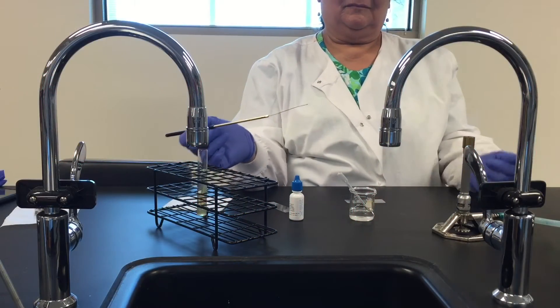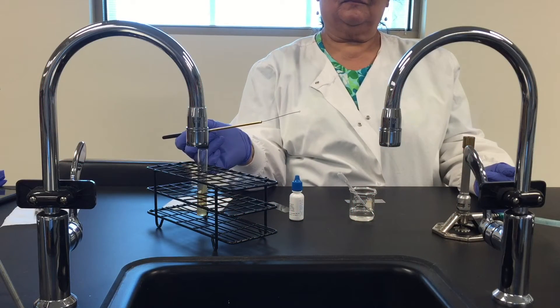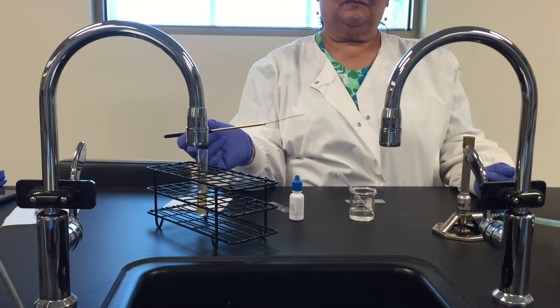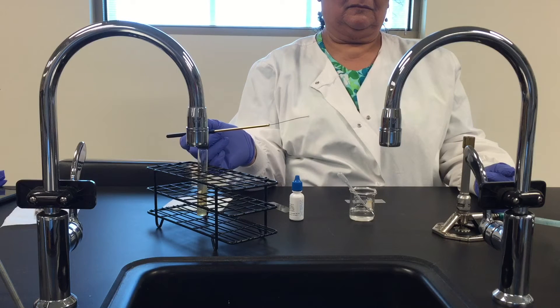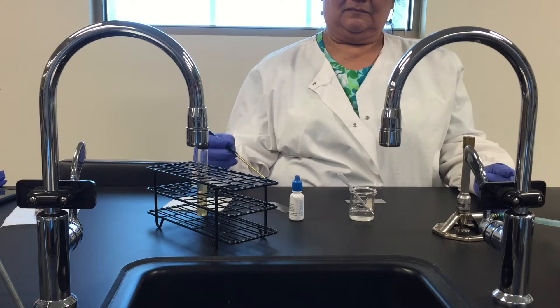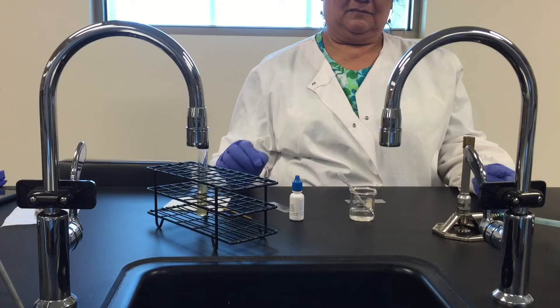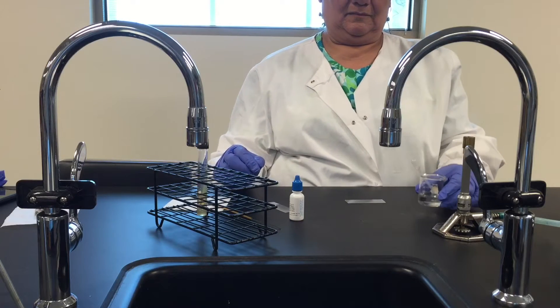Hi students, this is Professor Schimold and Renee and we're going to show you today how to make a negative stain. We do negative staining to detect the presence or absence of capsules on bacteria and here's how we're going to do it.